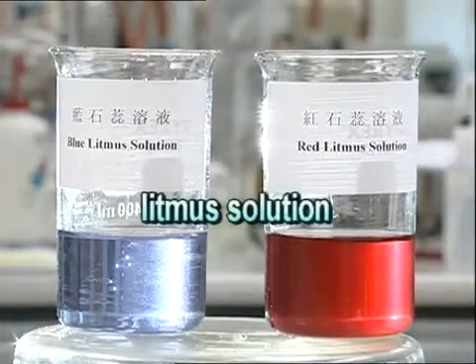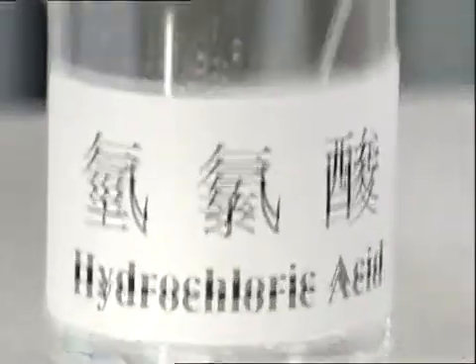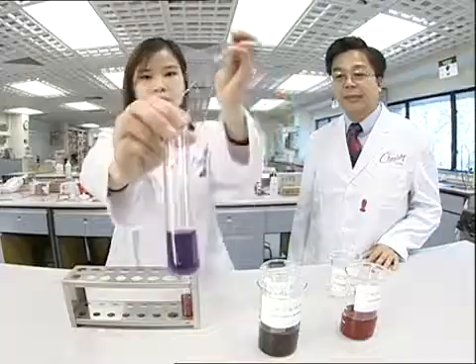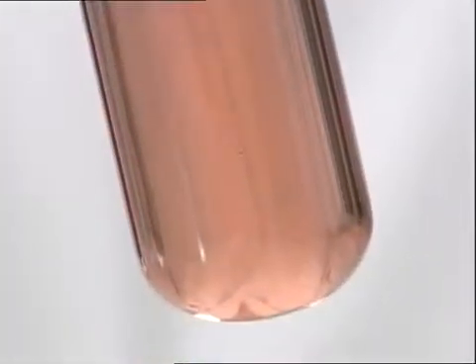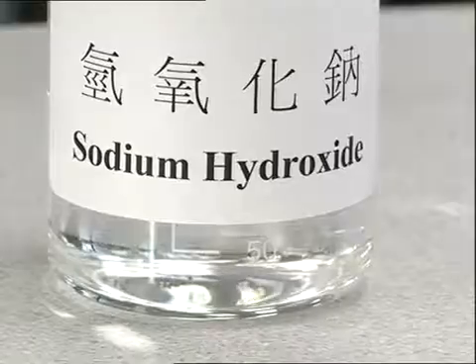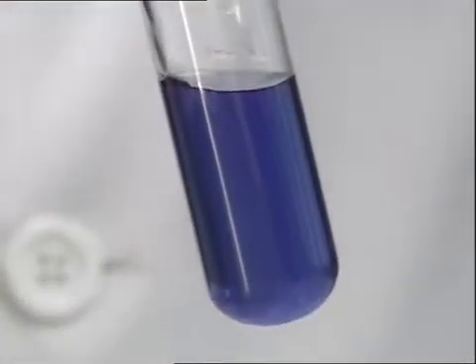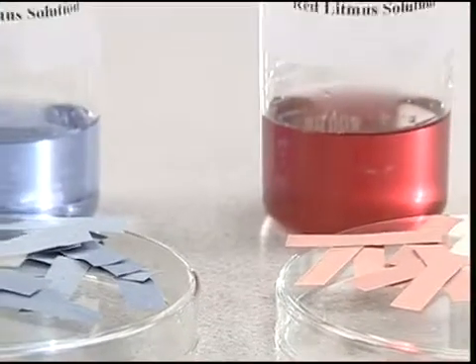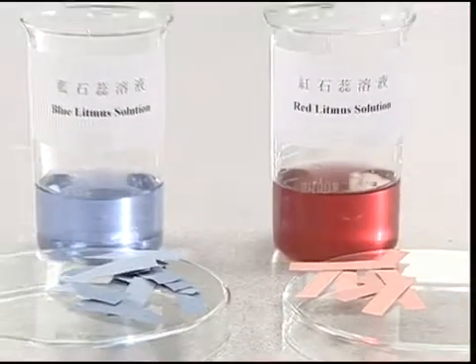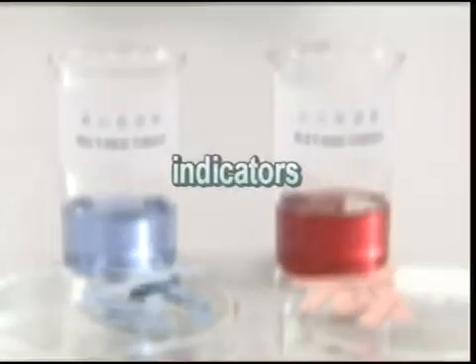Alternatively, we can test by using litmus solution. For example, if we add drops of hydrochloric acid to blue litmus solution, the solution turns red. On the other hand, the alkaline sodium hydroxide solution will turn red litmus solution blue. As both litmus paper and litmus solutions can indicate whether a substance is acidic or alkaline, they are referred to as indicators.